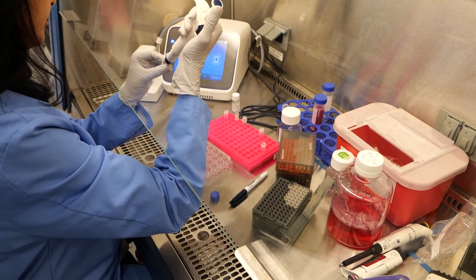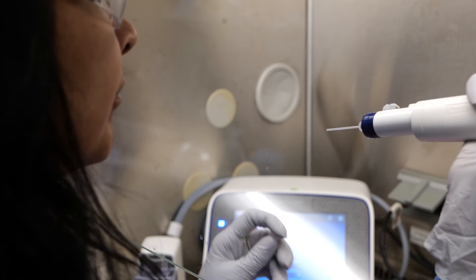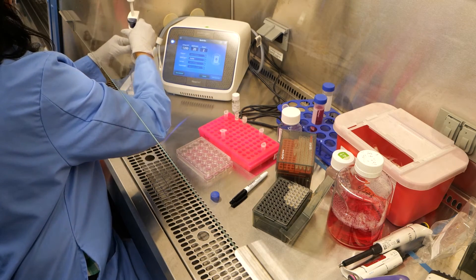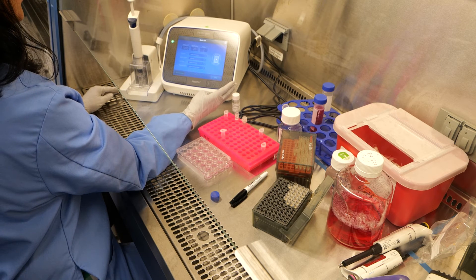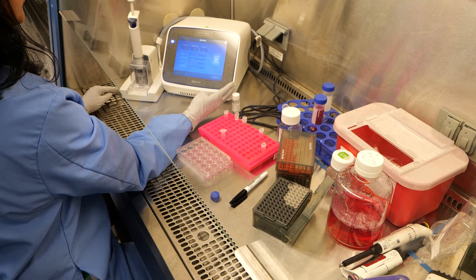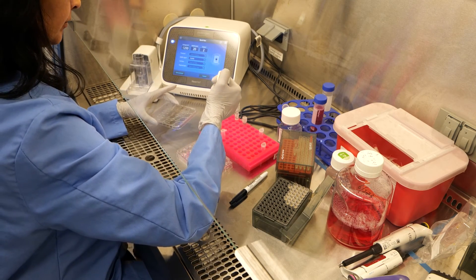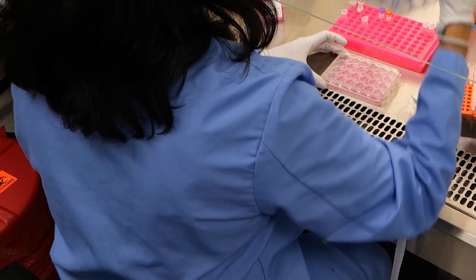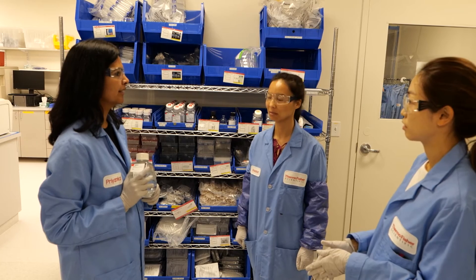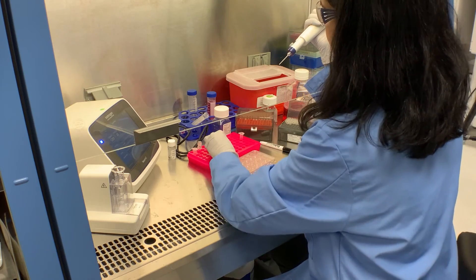Load the tip by pipetting slowly to help prevent bubbles from forming. Check the tip carefully for any bubbles. If you see any, gently pipette the solution back into its tube and then load the tip again slowly. If bubbles keep forming, try a new tip. Carefully load the pipette with your loaded tip into the pipette station. Once the NeonNext verifies that there are no errors or bubbles, press the Electroporate button. After confirmation of a successful electroporation, carefully remove the pipette from the station and dispense your cells into a well of your pre-warmed plate. Move the vessel in several quick side-to-side motions to disperse the cells across the surface. Electroporate all samples using a new pipette tip each time. To avoid contamination, do not use tubes more than 12 times. Change the tube and buffer when switching different payload or cell type.